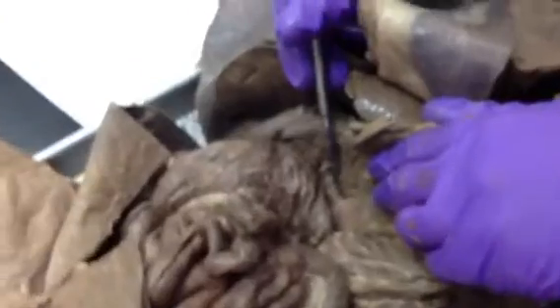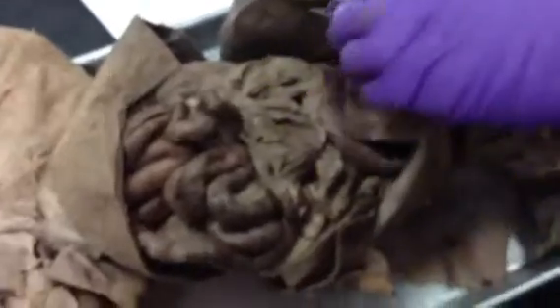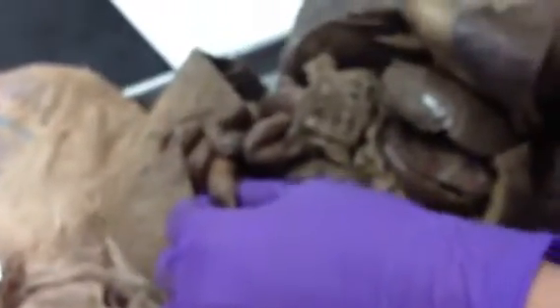And then for the cystic duct, just know that it drains the gallbladder, and then the common bile duct empties into the duodenum, and so they are here. And then the cystic duct just drains the gallbladder. And just know that the villi are the finger-like projections that are in the small intestine.